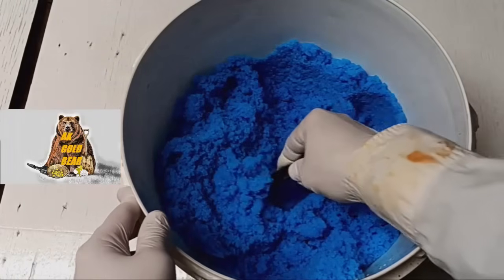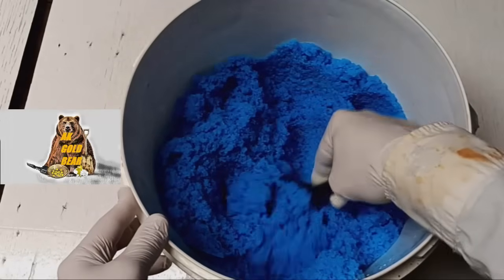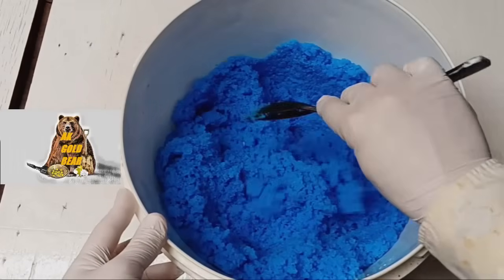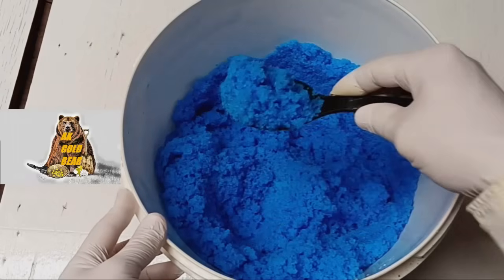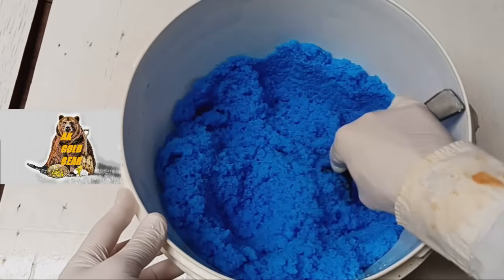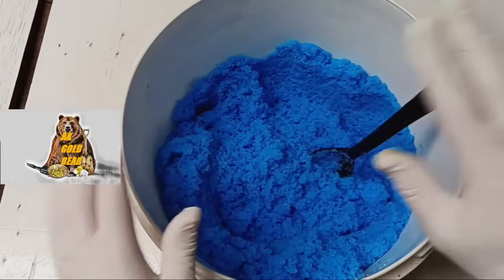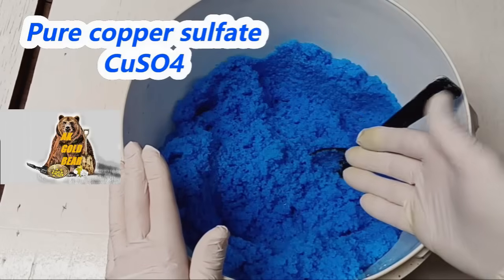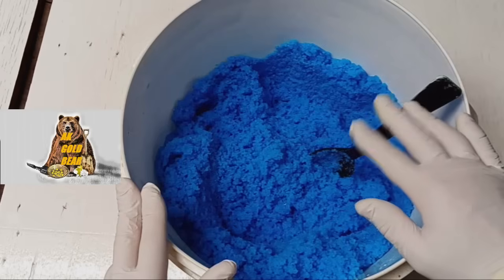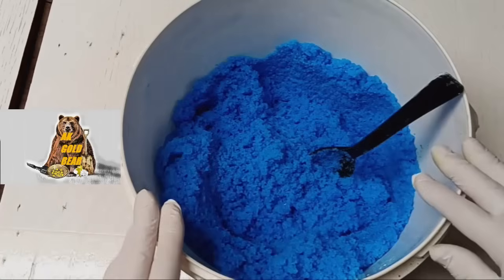I kept the copper sulfate crystals on the filter for 6 hours. My copper sulfate is not dry — I don't need absolutely dry copper sulfate. The person who ordered copper sulfate from me doesn't want dry copper sulfate. He needs it not wet and not dry. The main thing for him is that it is pure. And this is pure copper sulfate. I have been making copper sulfate for him for more than 2 years now, and so far he is happy with my product. And I am happy to do business with him.